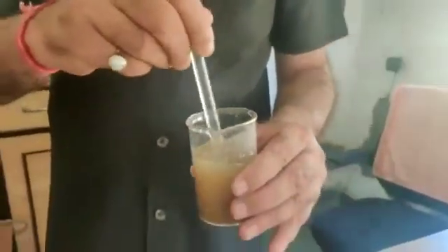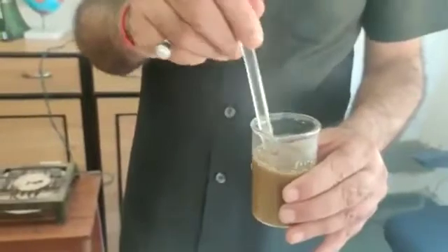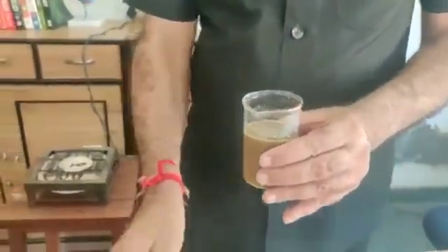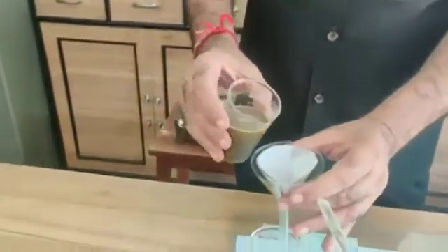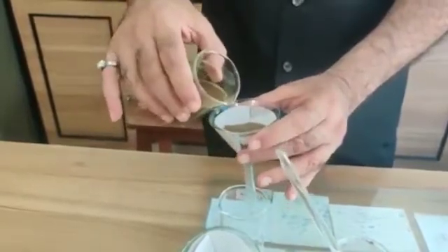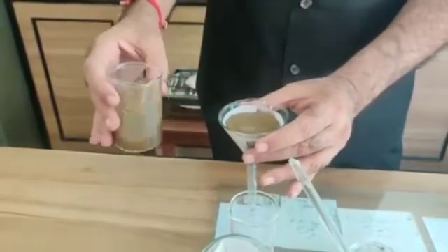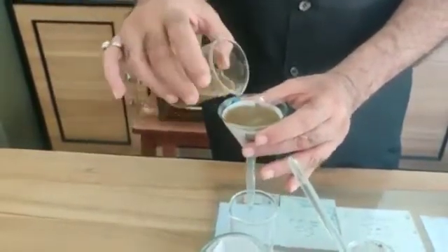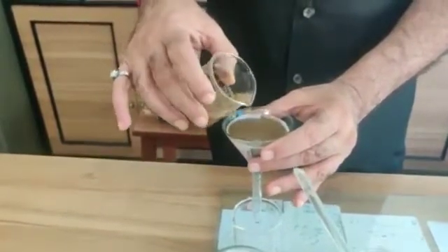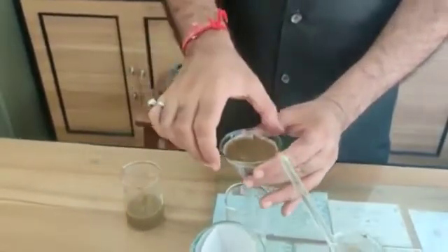This is our Sample A. We will stir it, mix it well, and pour it into this funnel having filter paper A. The water will drain out and the particulate matter will remain on the filter paper. We have to pour the entire quantity of water into this funnel.